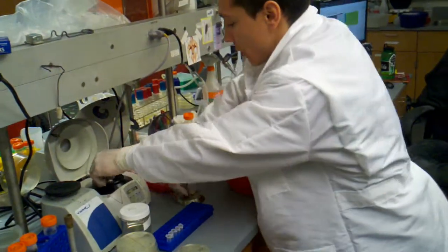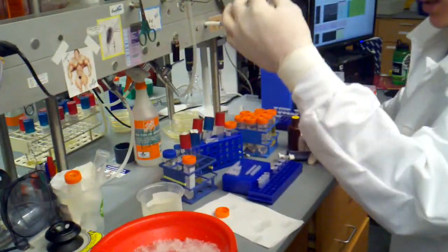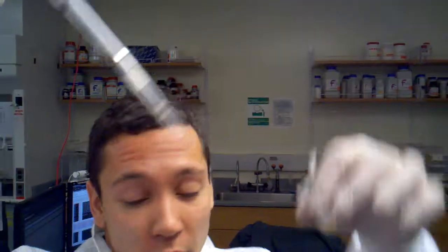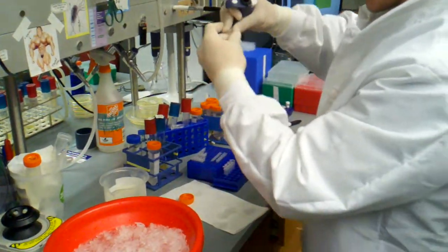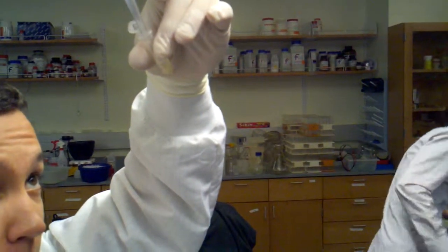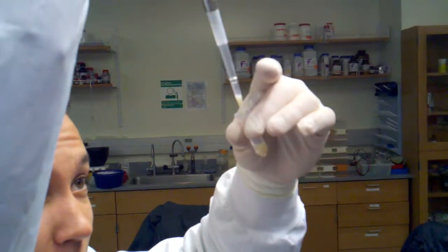So pull both off. Ice, and now you can see a very nice and clear pellet. I'm going to tip that and stick my tip right in there and pull it off. And same thing for that other one. So it's even better looking. I'm getting some of those cells, but we gotta deal with that. There we go. There we go.